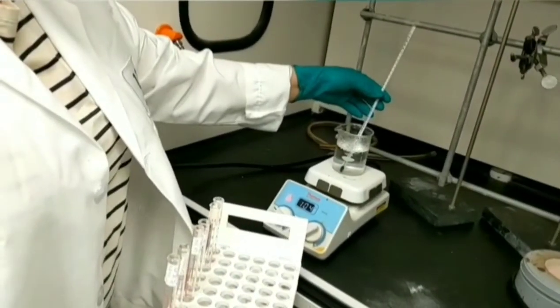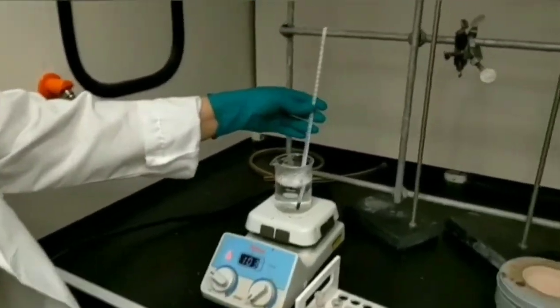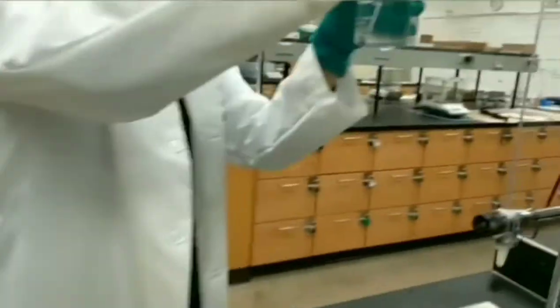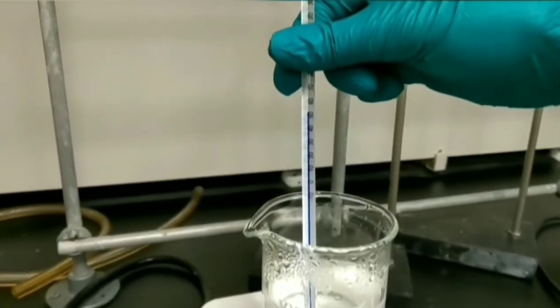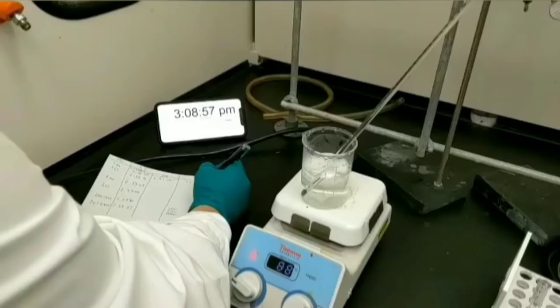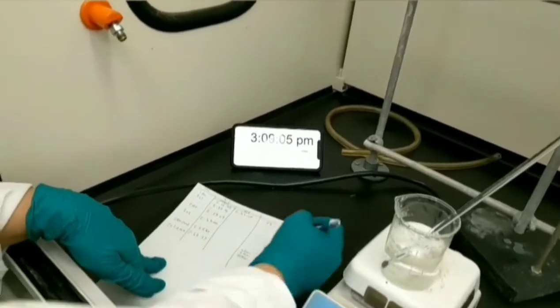So for the 1-chlorobutane and 2-chloro-2-methylpropane, we record the finishing time of the reaction, but I still prefer to put them in the water bath in order to check them for any precipitation or cloudy solution. The temperature of our water bath is higher than 50 degrees, so I'm adding cold water in order to cool it down to 50 degrees centigrade. For recording the starting and ending time of the reaction in the 50 degrees Celsius water bath, I'm adding 2 more columns to my table.